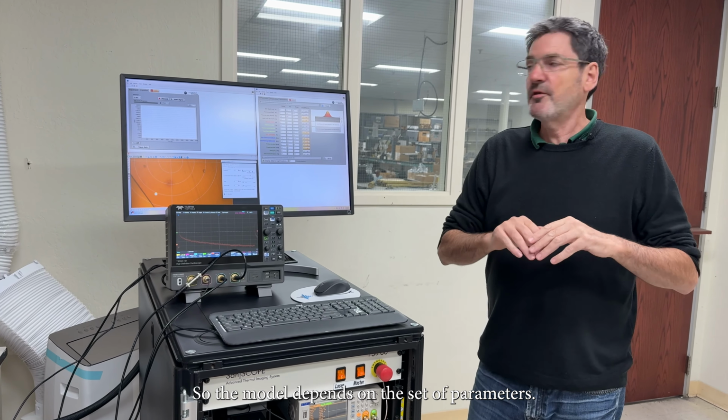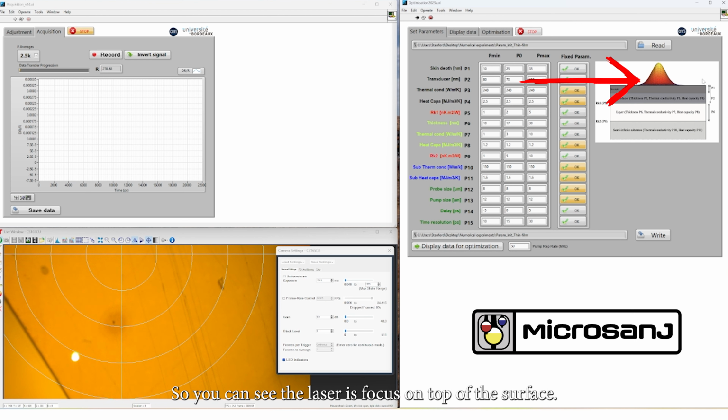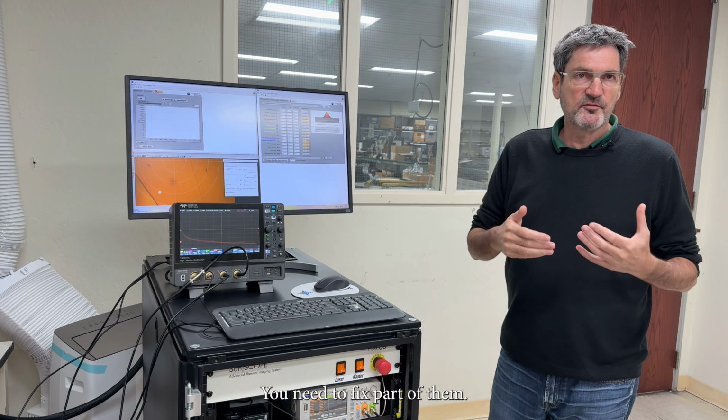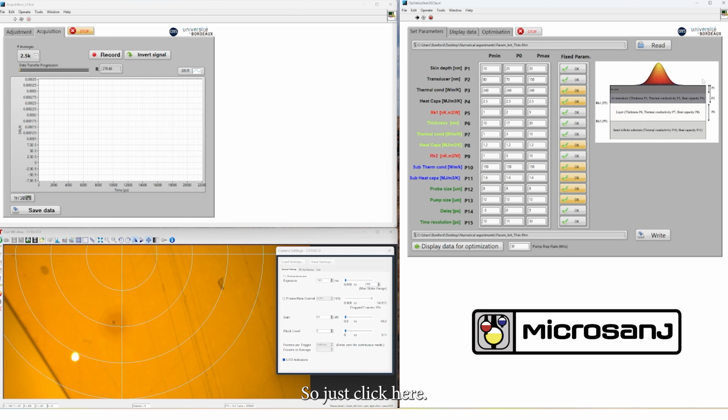So the model depends on a set of parameters you can see here, and is described here on the right. So you can see the laser that is focused on top of the surface, and the heat flows through this entire structure here. And you see that this structure is described by the set of 15 parameters that you can see here. And of course, you are not going to identify 15 parameters at once. You need to fix part of them. For example, the thicknesses or the heat capacities. So just via a click here, you choose the parameter you want to fix, and you leave free the other parameters here.